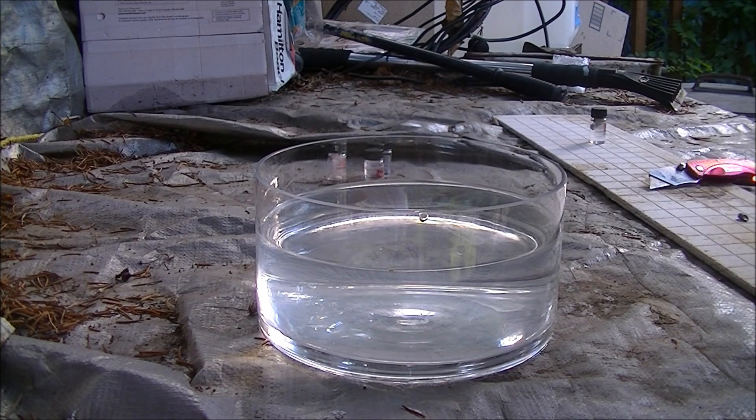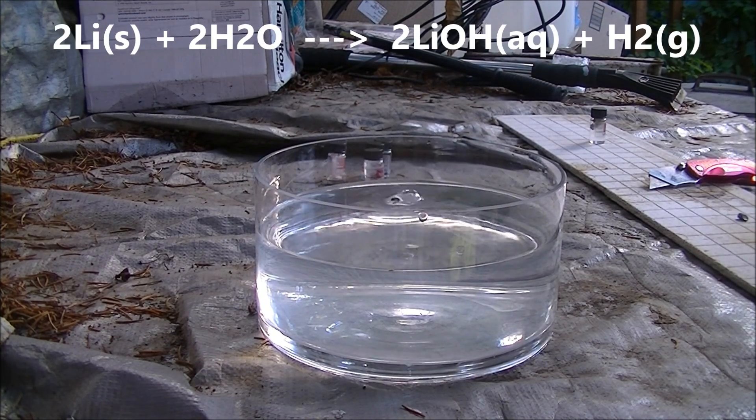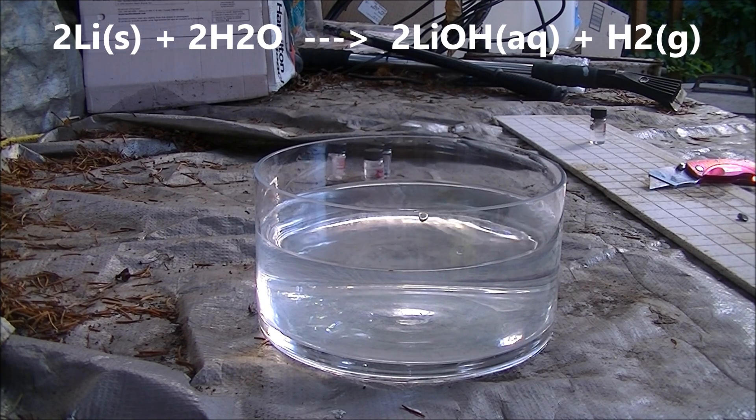First metal I'll do this with is lithium. You may have done this one yourself in school when you were younger.